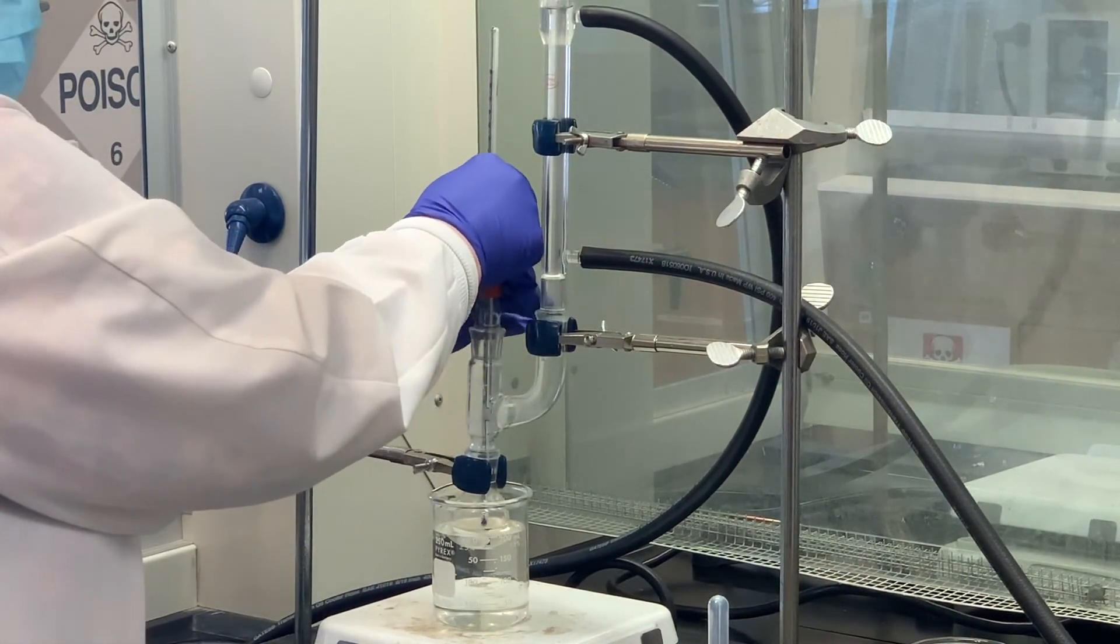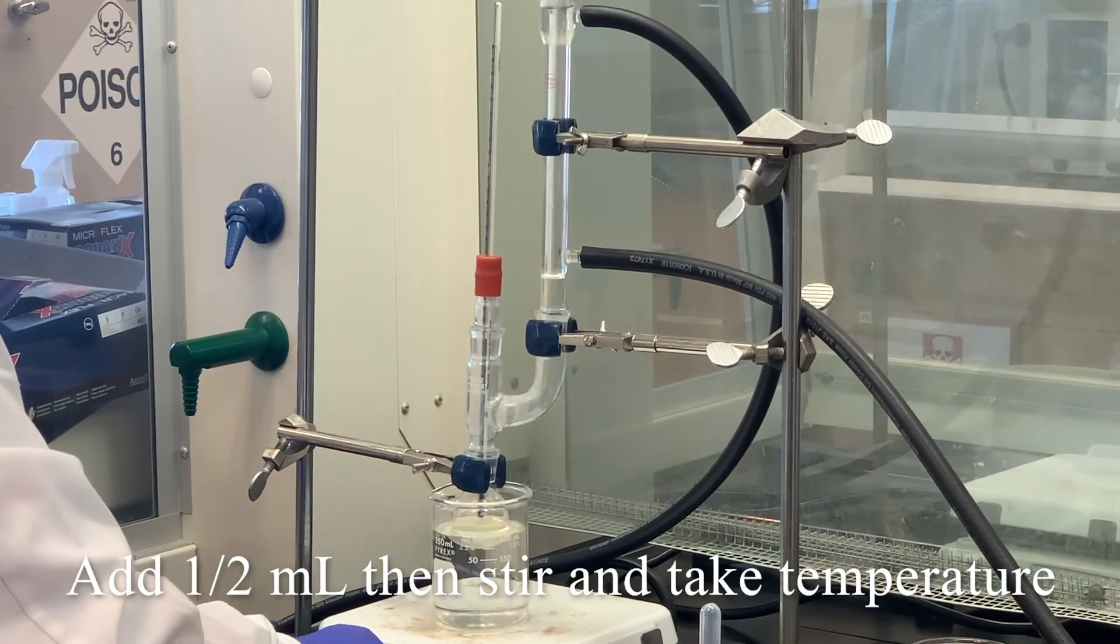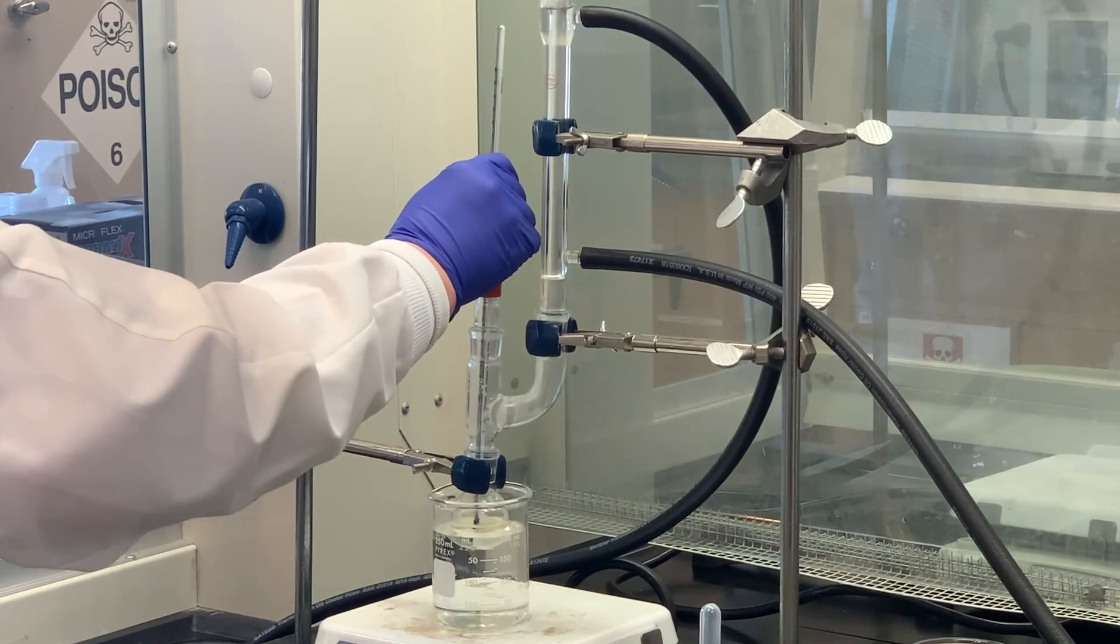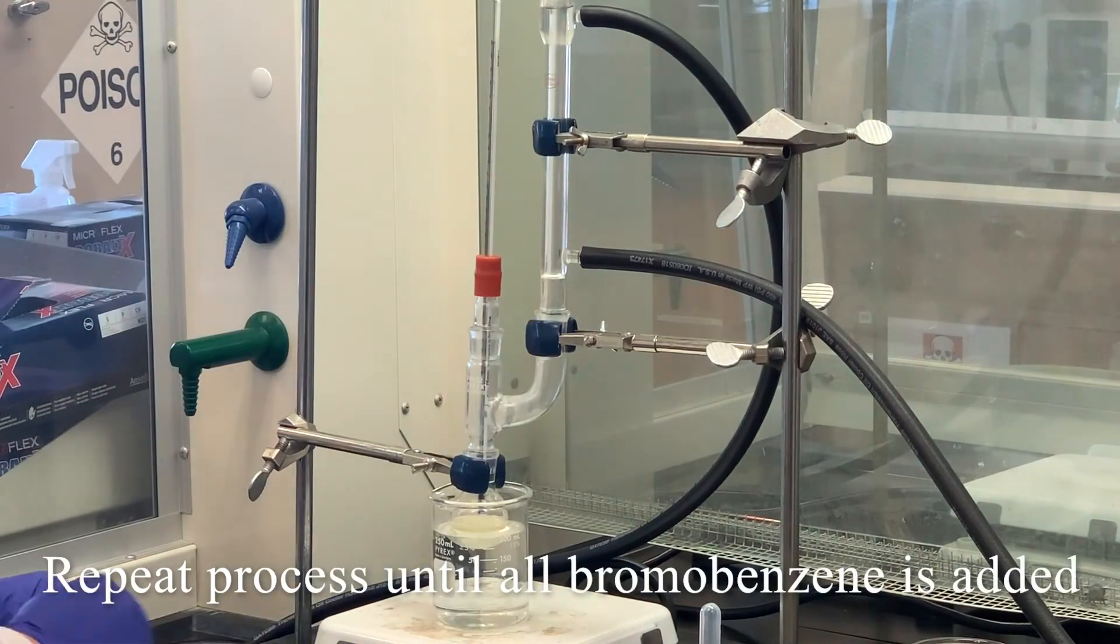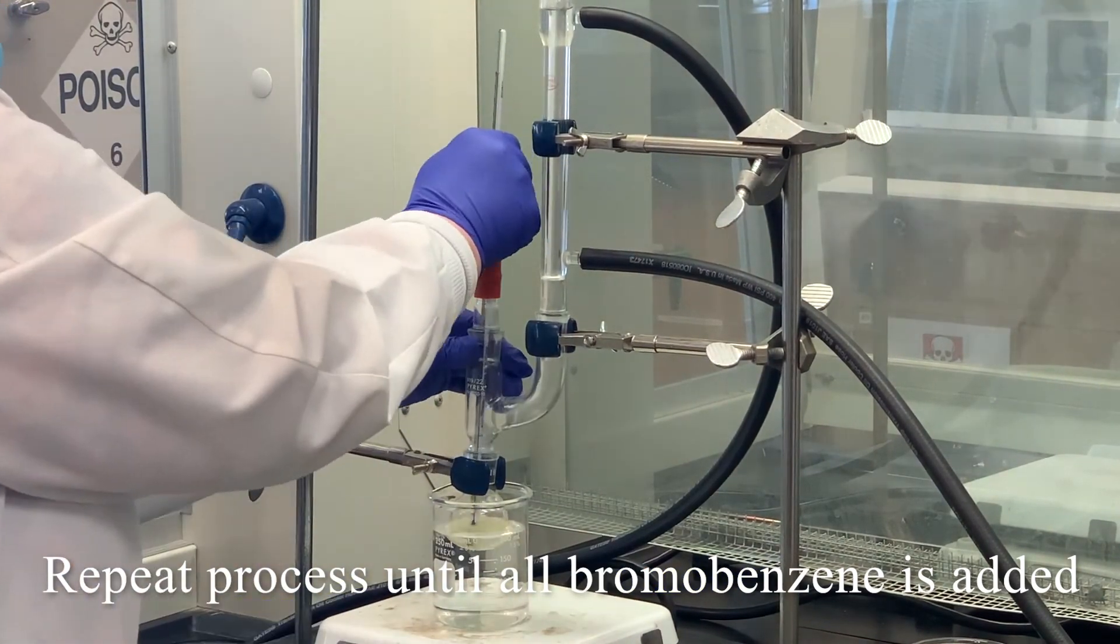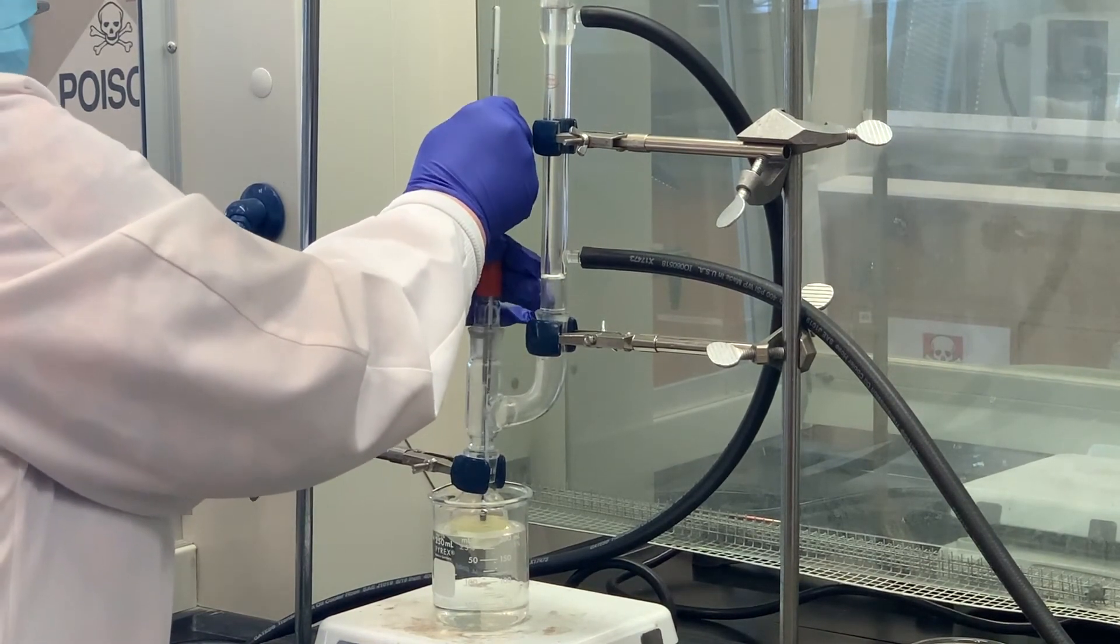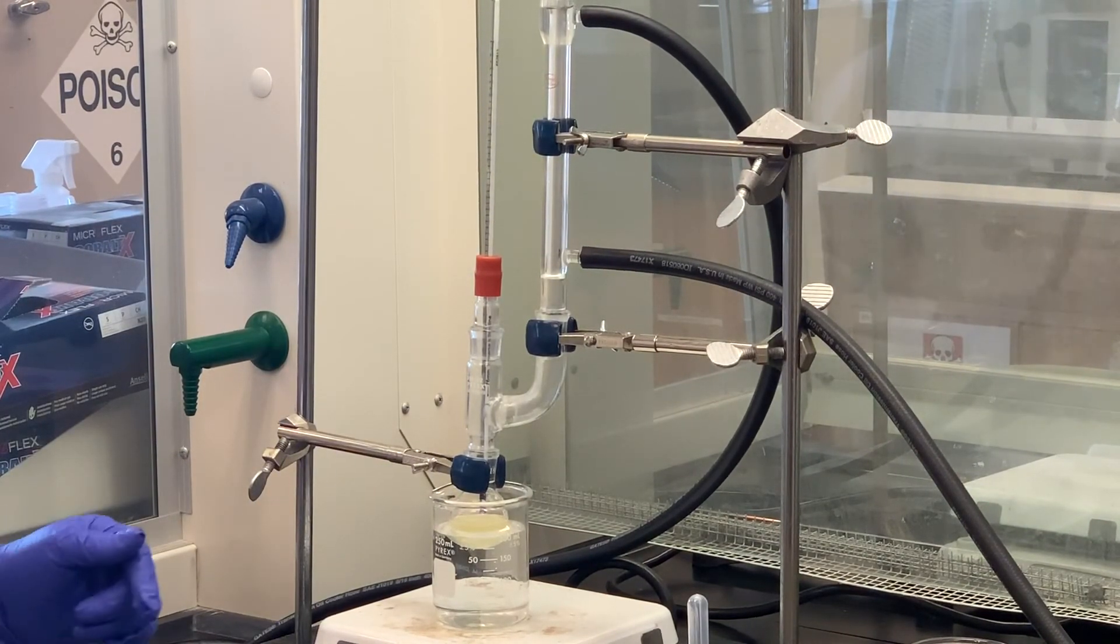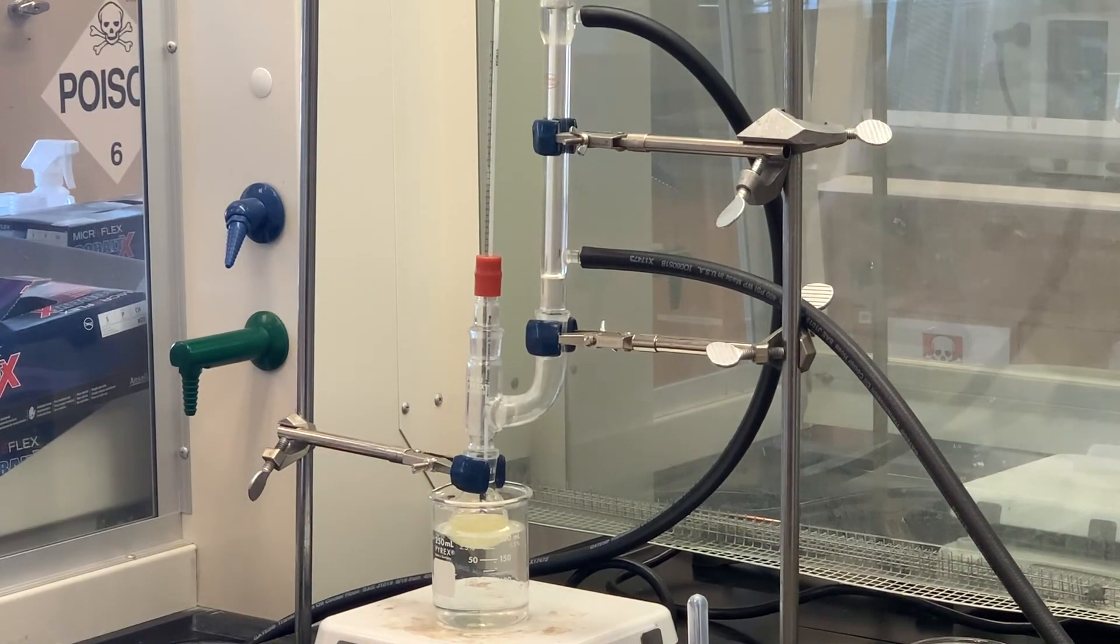It's cooled back down, so I'm going to add some more. Temperature is hovering around 30 degrees. It's still around 30, so not much difference. It's been about nine minutes since we did the first addition. As you can tell, the color of the solution is getting a little bit more yellow.